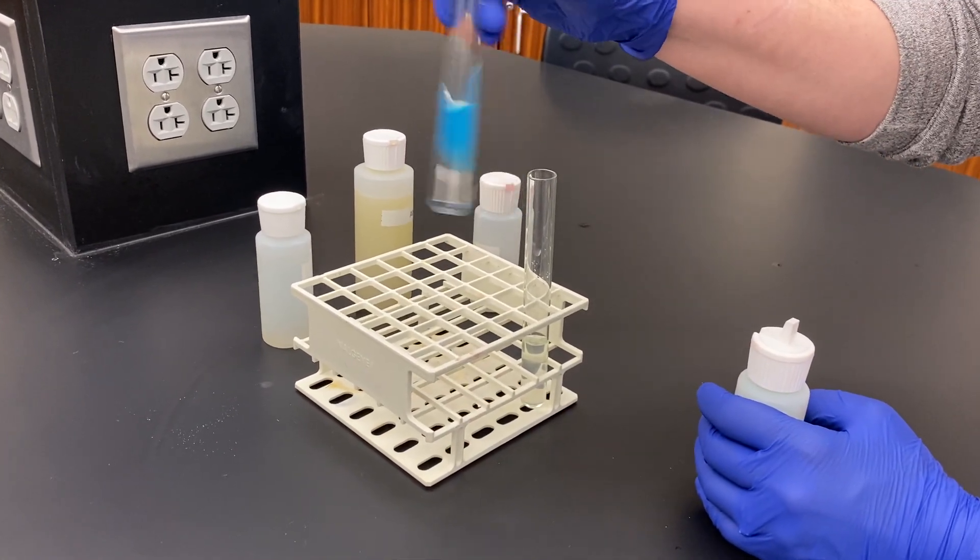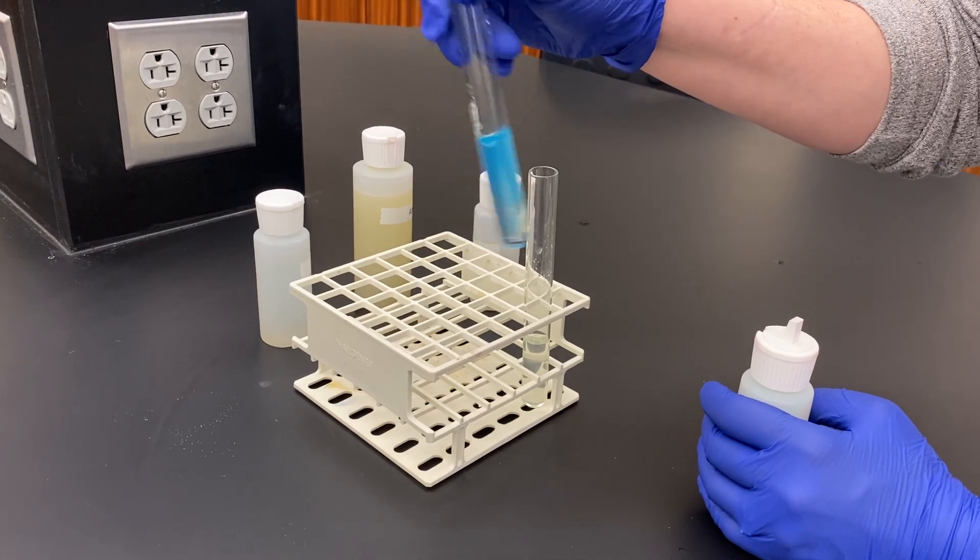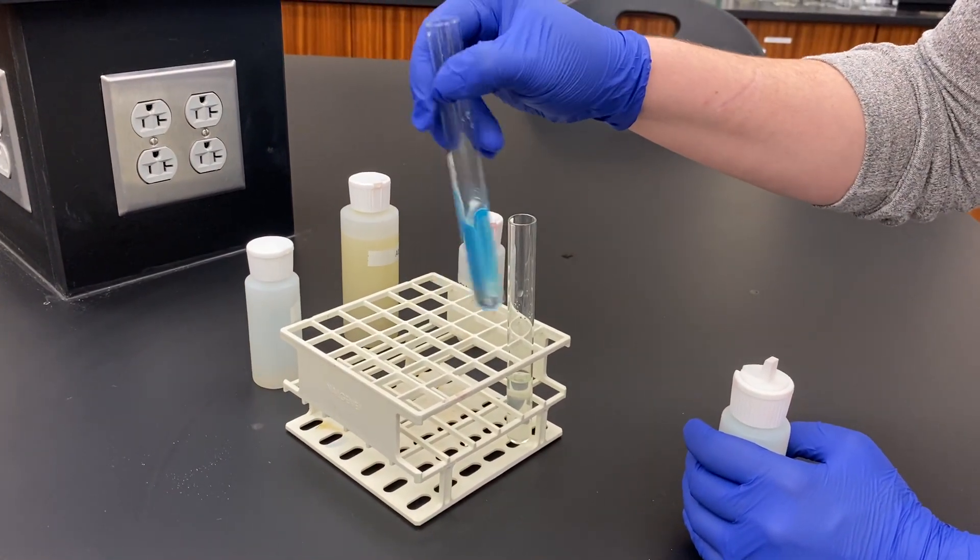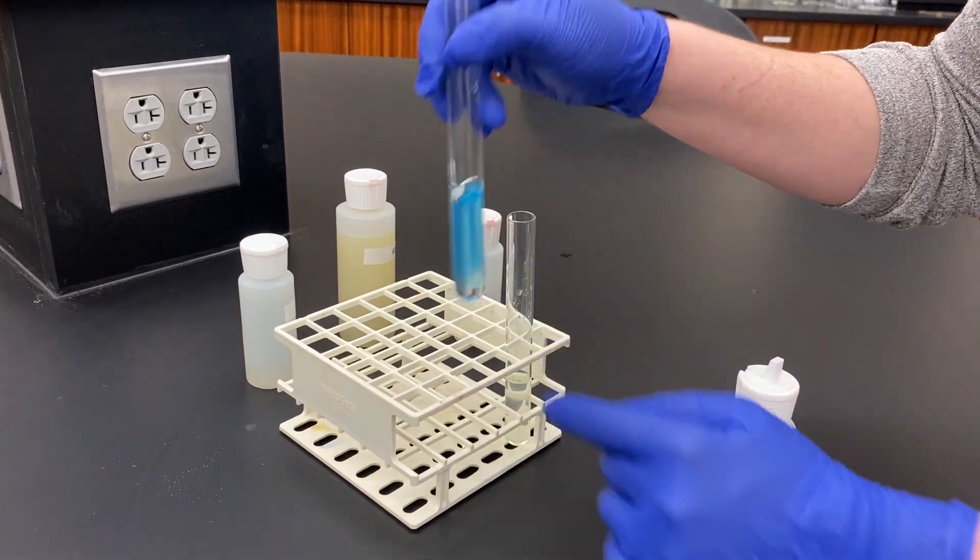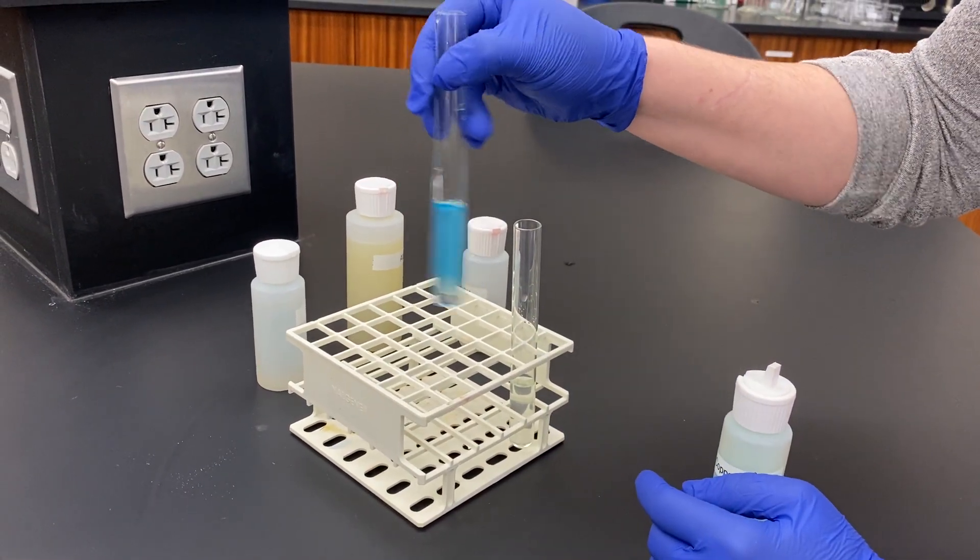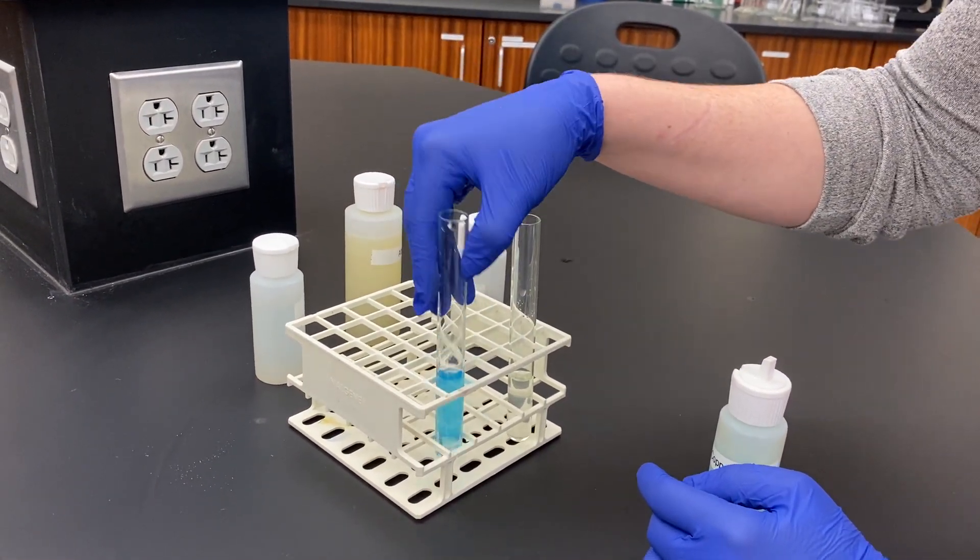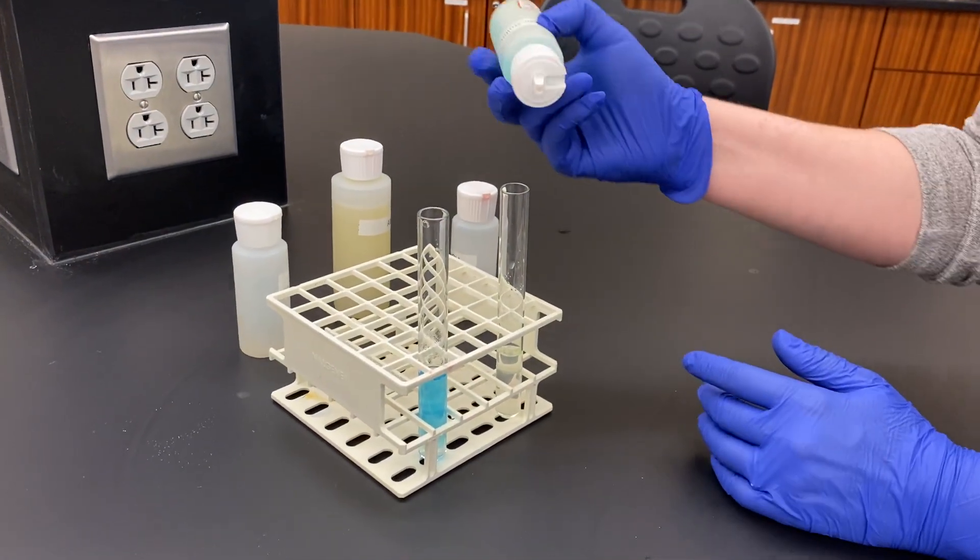Whenever I mix this up, I'm going to continue to have that blue precipitate forming. And if I were to allow this to settle, that blue precipitate would settle on the bottom of my test tube. We're going to let that sit for a second while we do the next one.